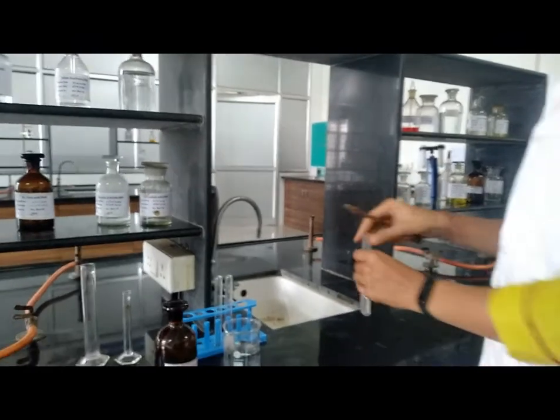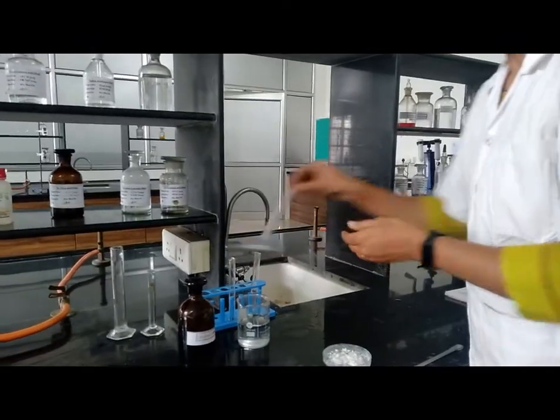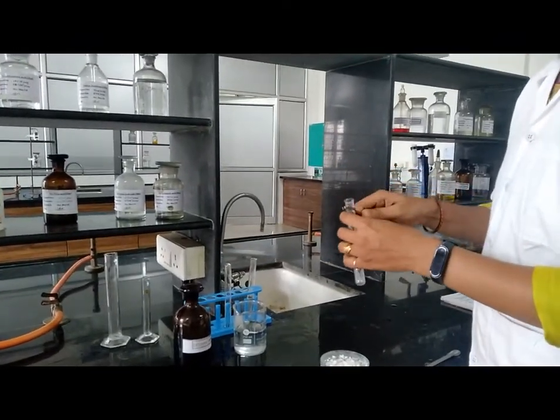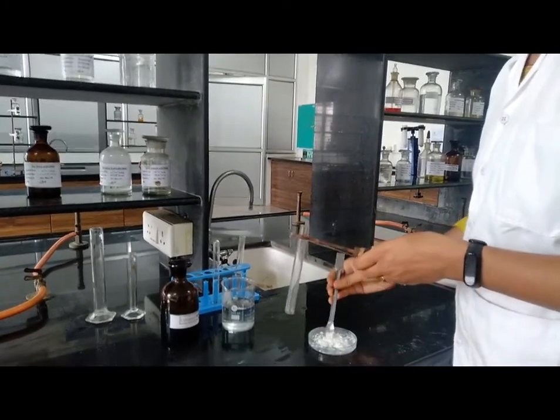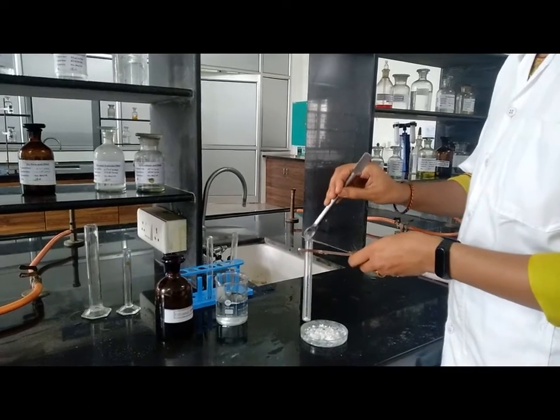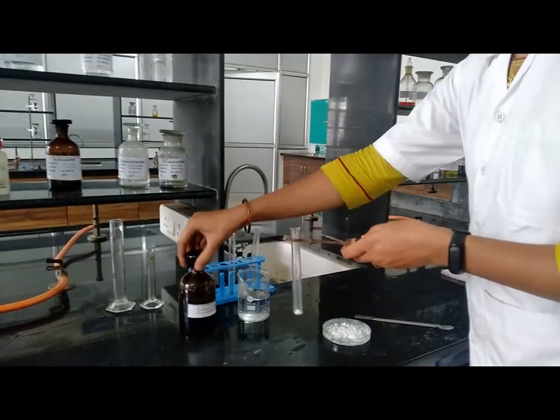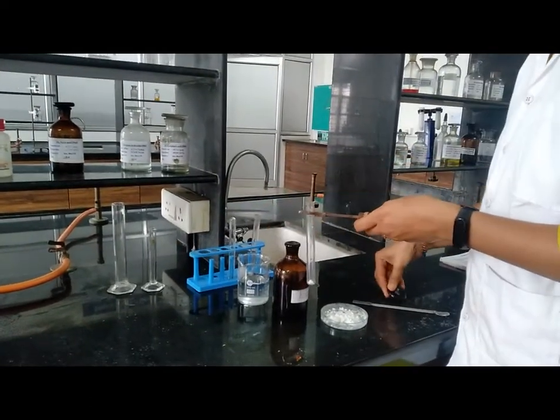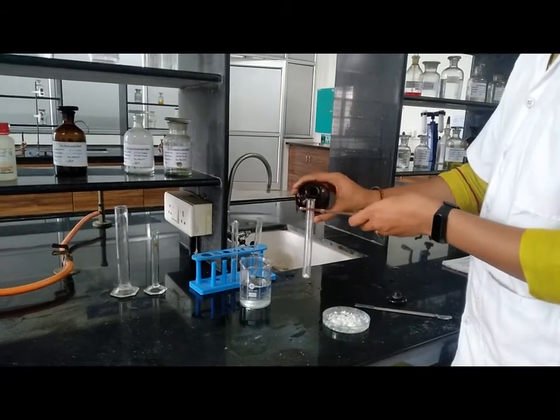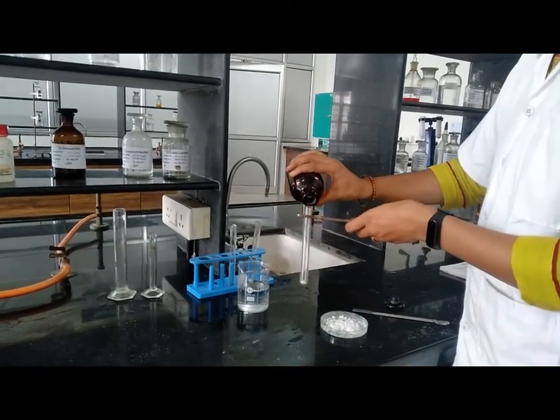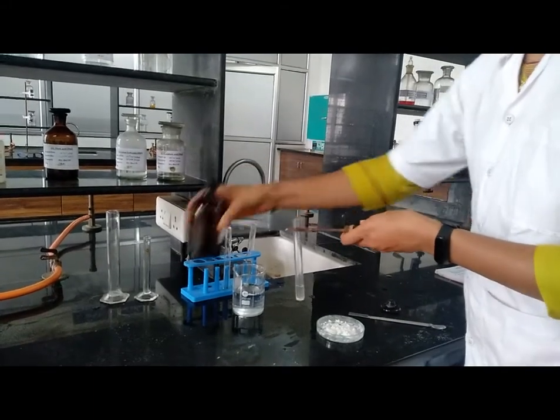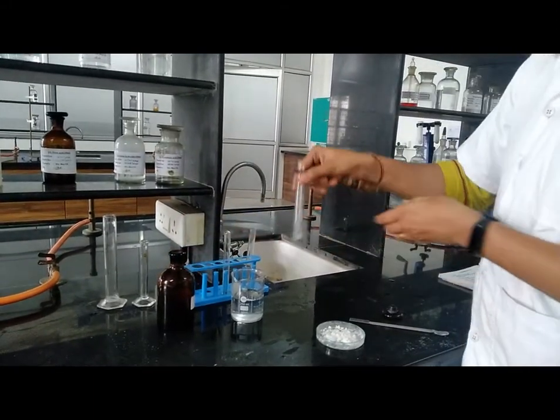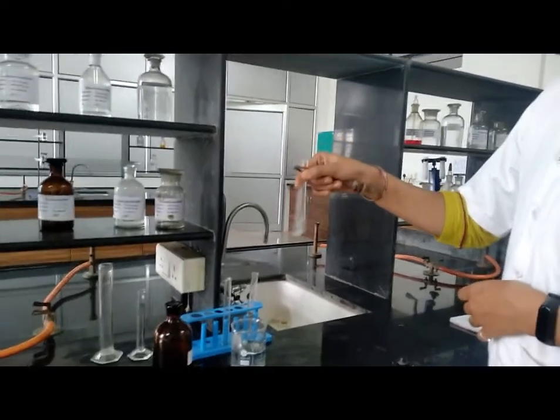Now, next test: check the solubility in 95% ethanol. Again, take sample 0.3 to 0.4 gram and add 95% ethanol and check solubility. In ethanol, it is soluble.